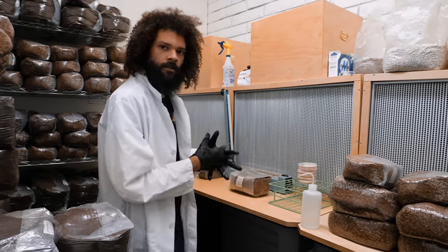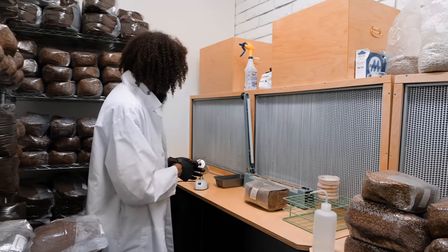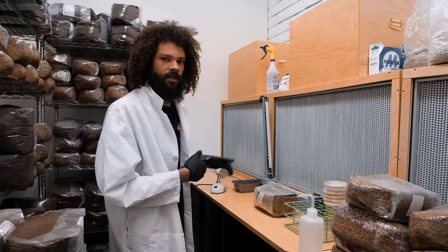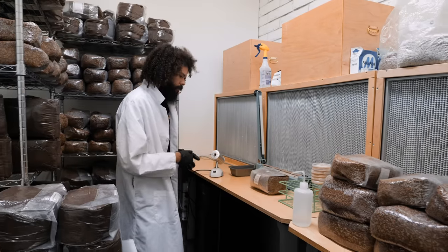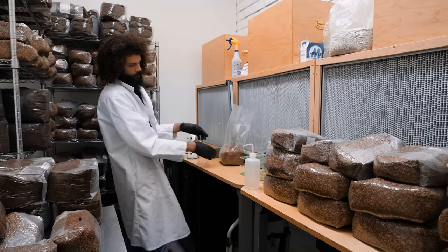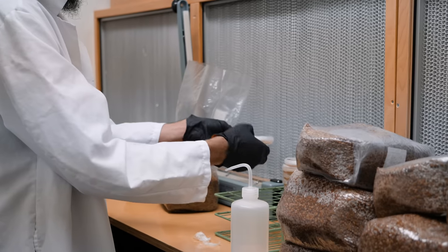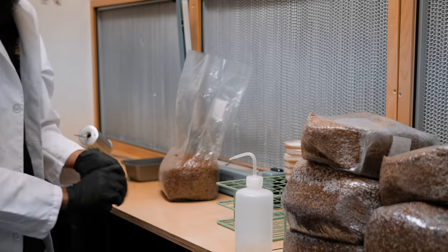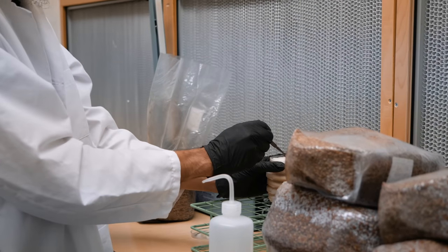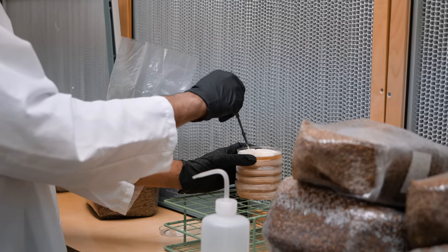I like keeping one of these wash bottles handy so I can wash my hands with a little rubbing alcohol between transfers. After every certain amount of movements, you always want to re-sanitize your hands, wipe down your work surfaces, just to maintain sterile technique. We'll heat up our scalpel in our bacti-incinerator, go ahead and open our bag into the laminar flow, and here we go.